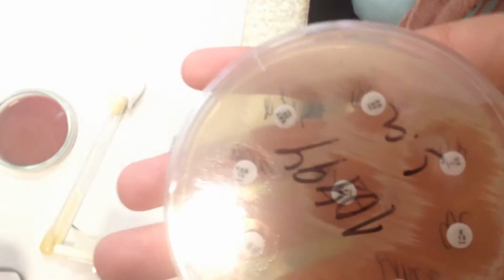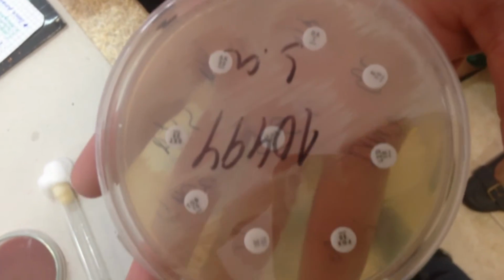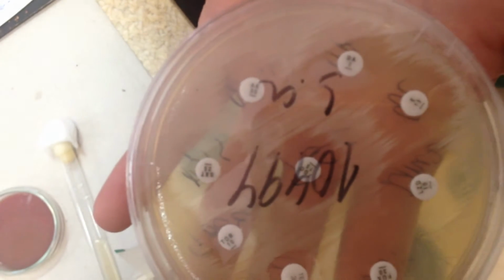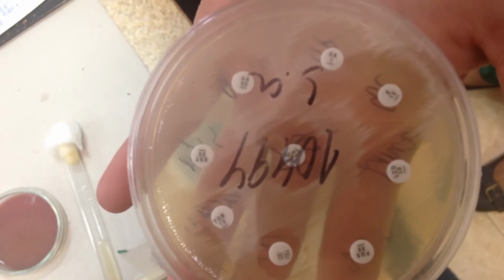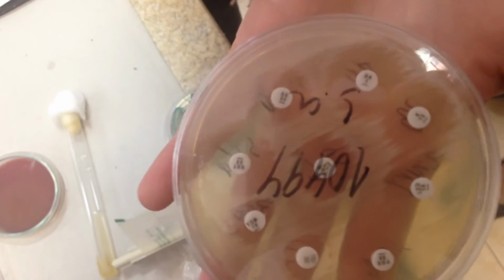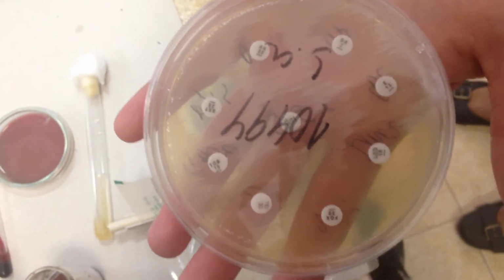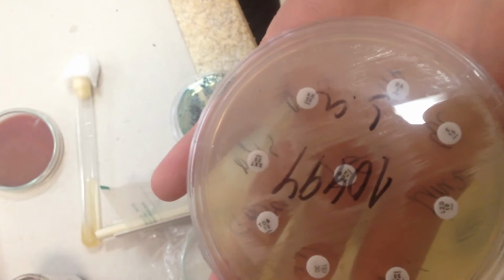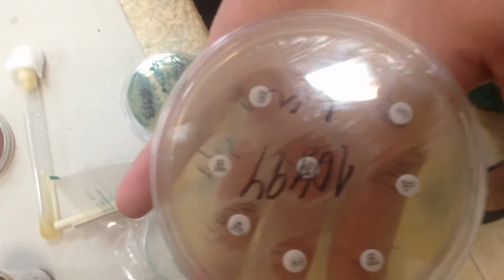Standard antibiogram by the Bauer-Kirby method. It is a Petri dish that checks for the antibiotic susceptibility of bacteria. Circles around the disc indicate susceptibility to antibiotics. These are methods to determine the sensitivity of microorganisms to specific antimicrobial drugs. We find the zone of inhibition, and we have a minimum inhibitory concentration. The pure culture from the patient has to be isolated first.